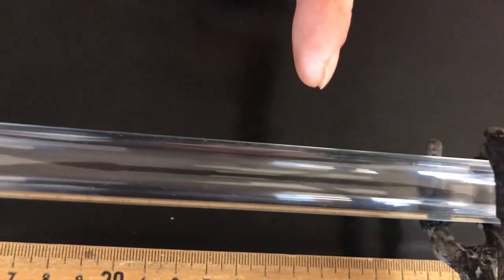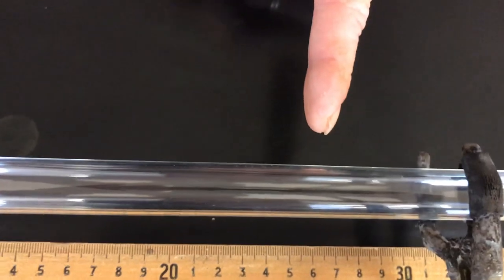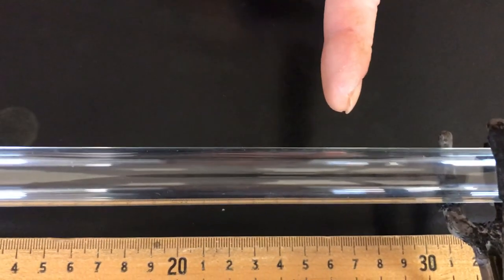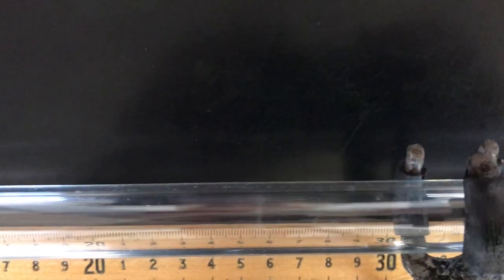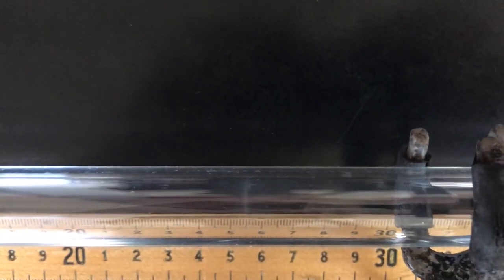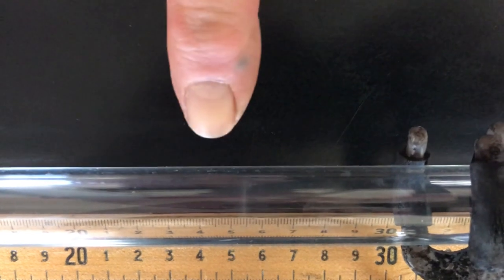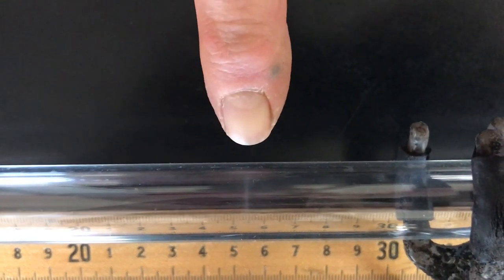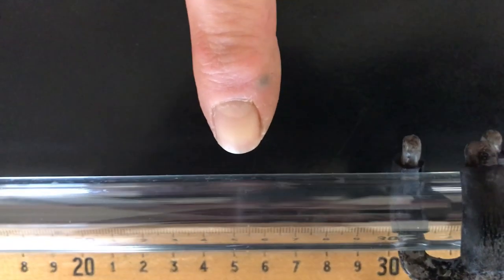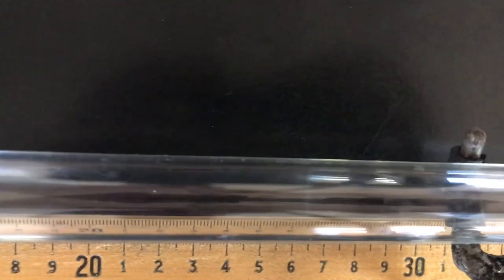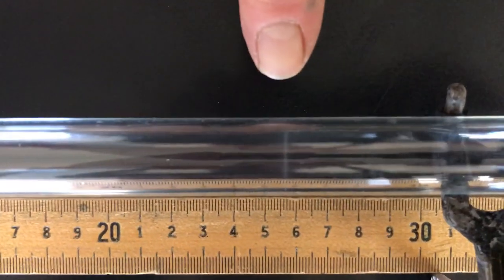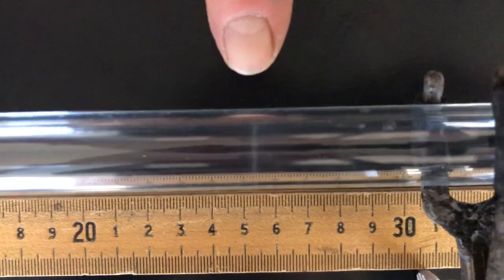Is it showing up in the video? Nope, it's not. Great. Well, right where Mr. Hevel's finger is. Now, Mr. Moore, if you come over here, I got the ring stand as a backdrop, I can see it here. Yep. Right there at about 25 and a half centimeters. See that? Yep. When I give it any angle, I get more layers. Well, I can see it really good right now.